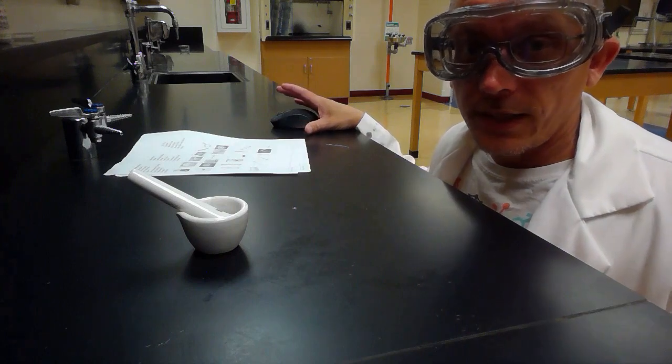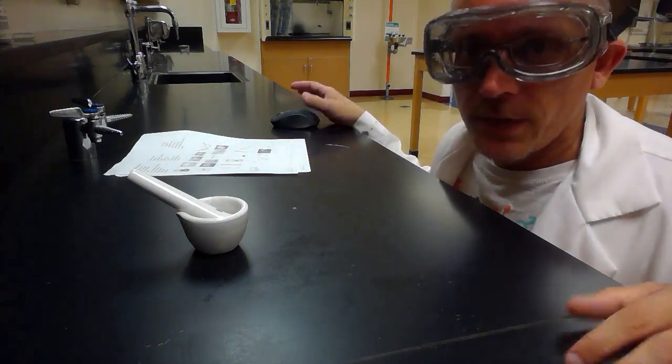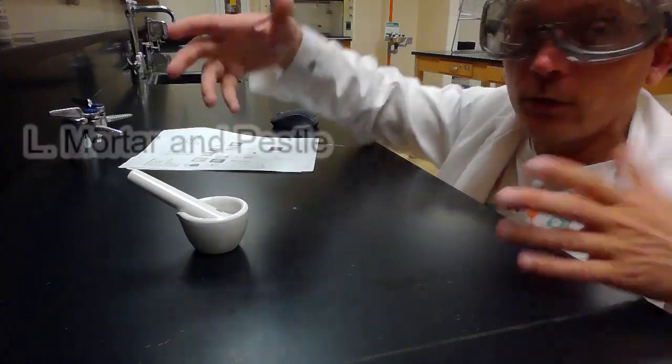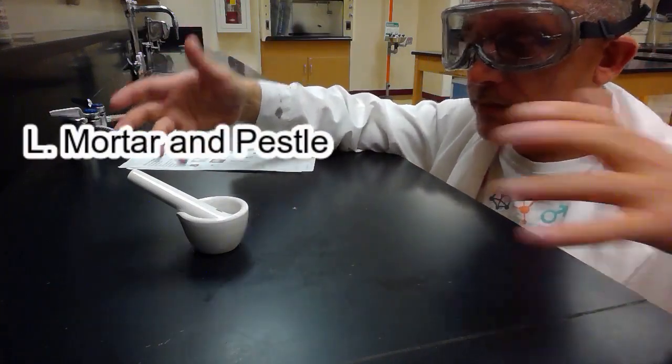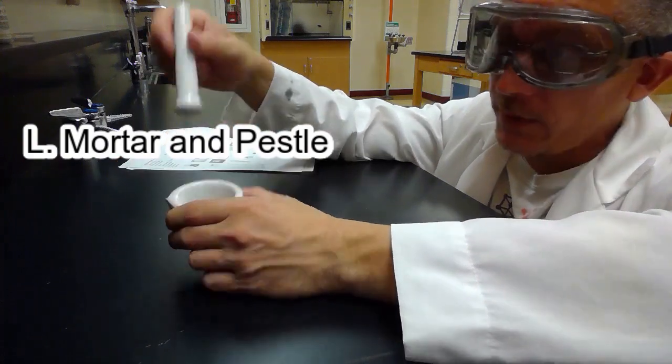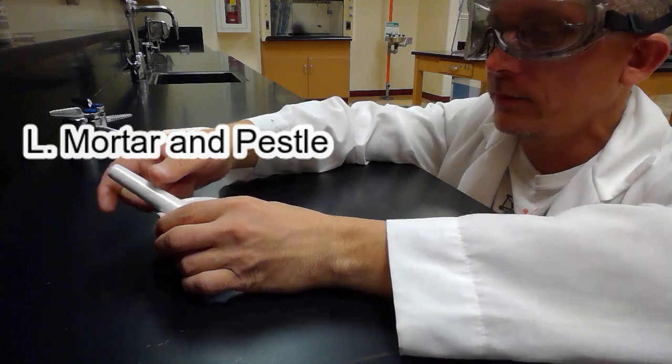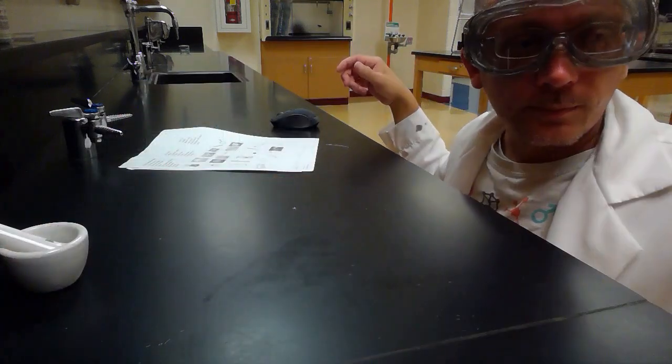Okay, a few other ones here that I didn't squeeze into any of the groups. This one right here is picture L. It's called a mortar and pestle. Mortar and pestle is used for grinding things up. You can put something in there and then use it to grind it up, right? That's a mortar and pestle. It's used for grinding things.